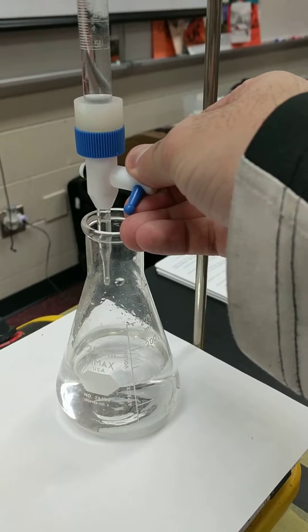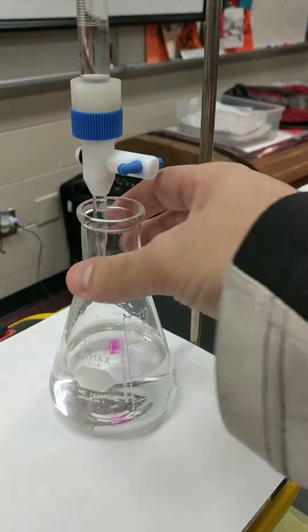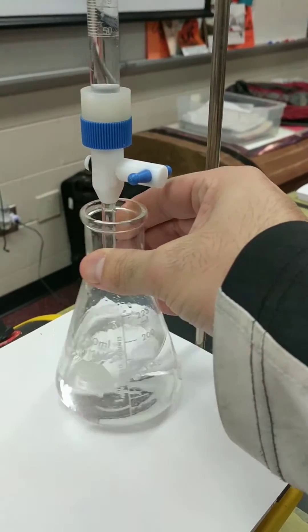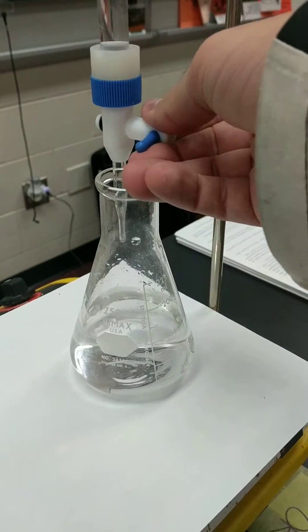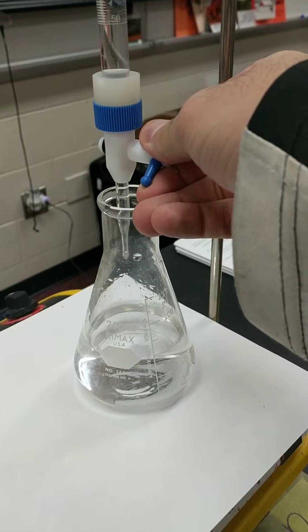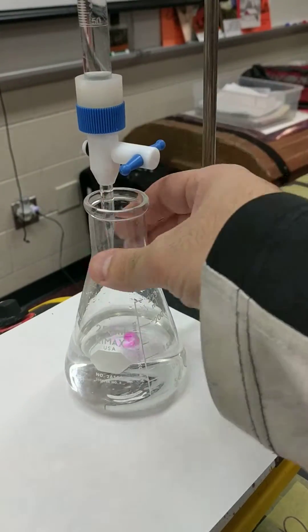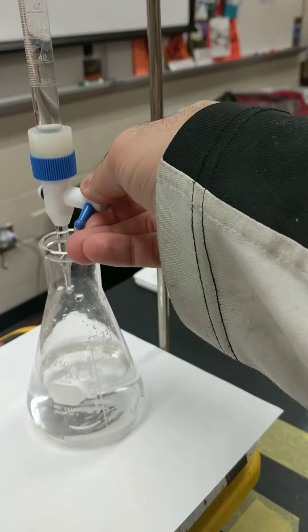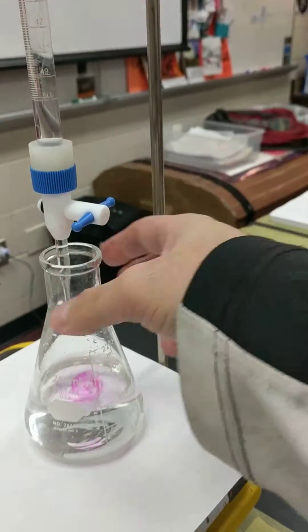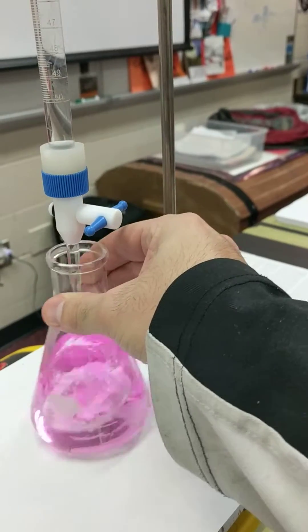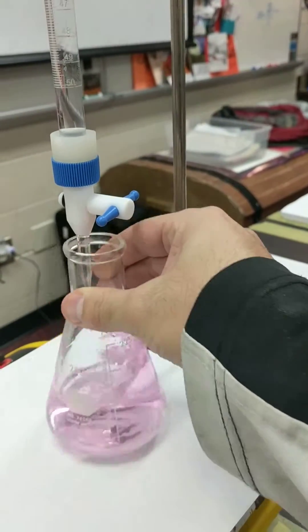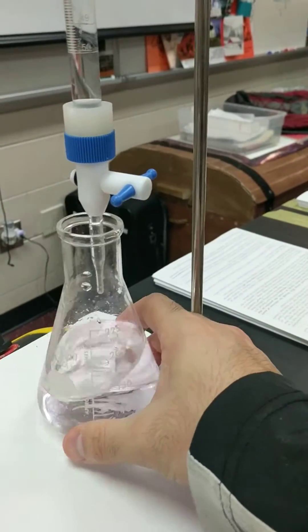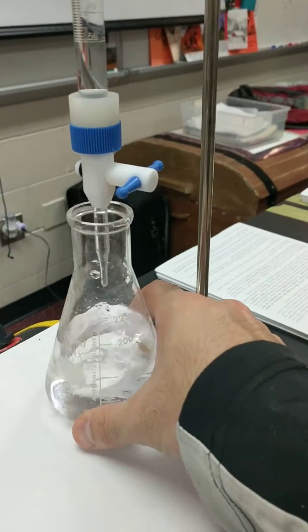All right, one more drop. We're so close here. One more drop. Not yet. Maybe I'll do one, two drops, three. All right, oh, and then it goes faint, faint, faint, faint, faint. Did you see that?